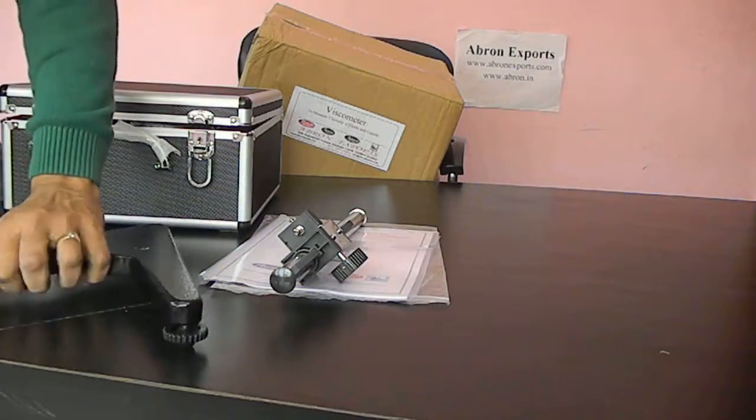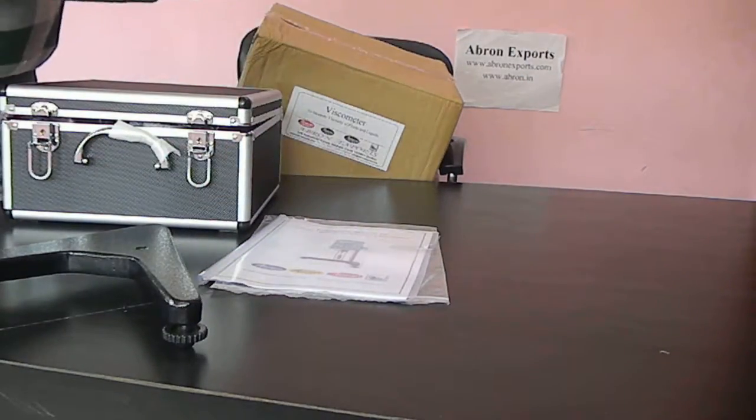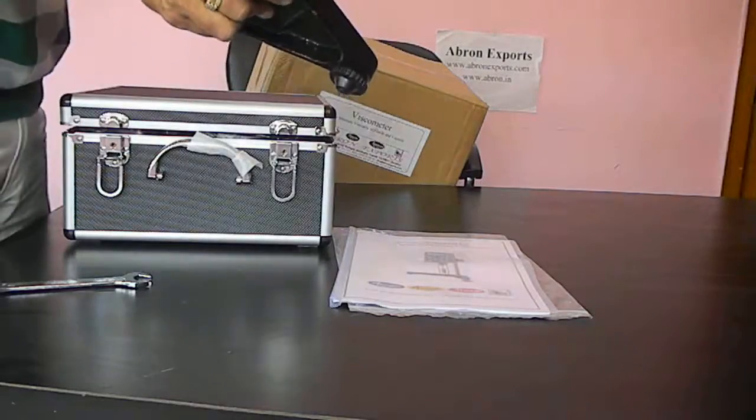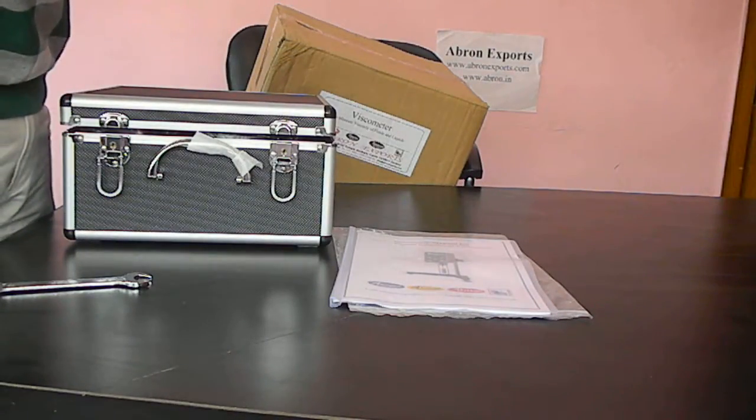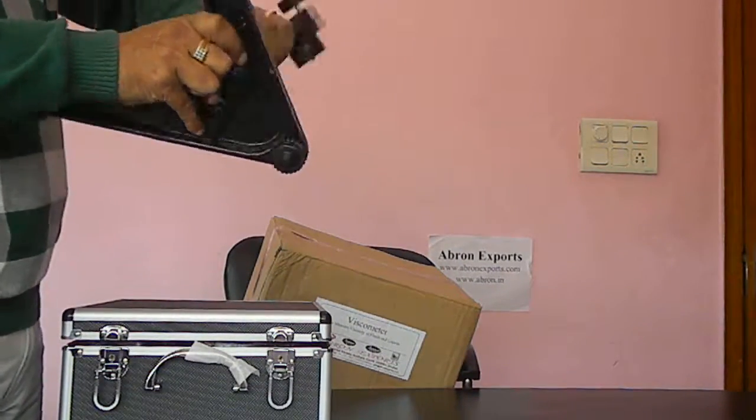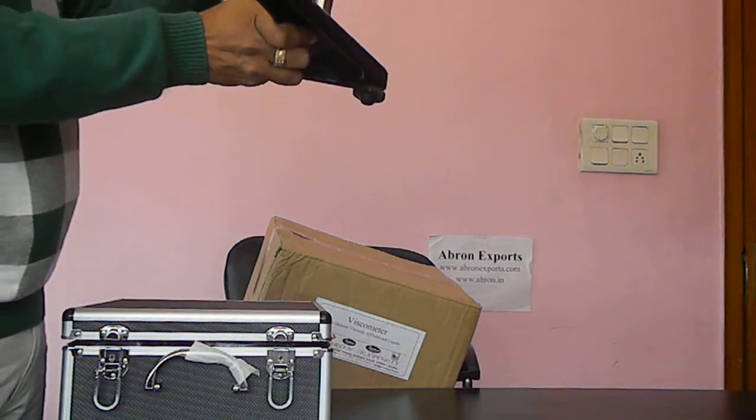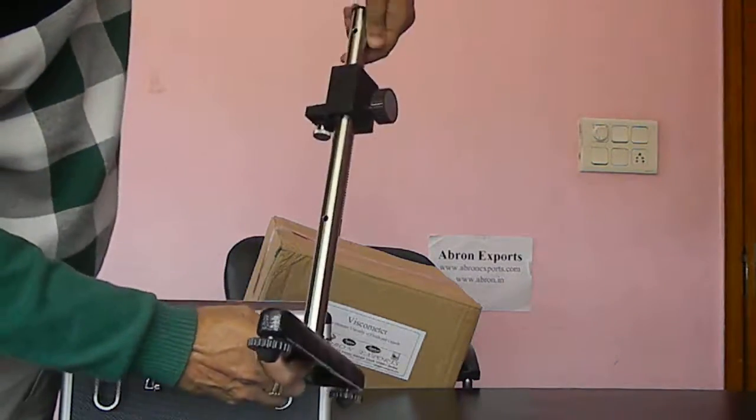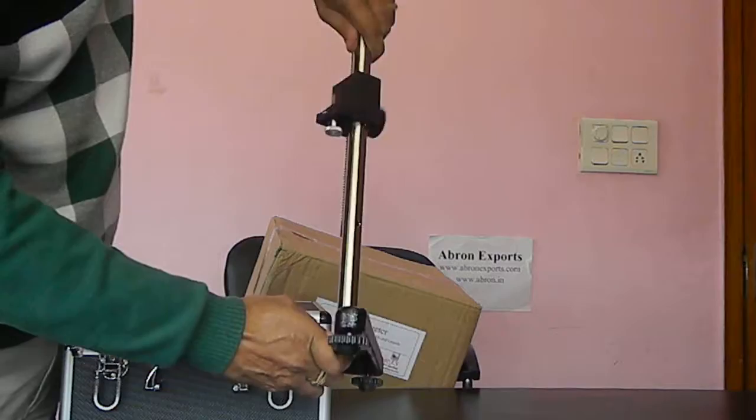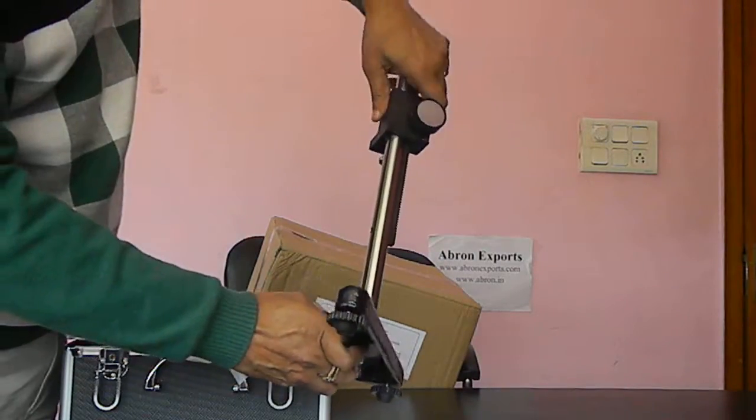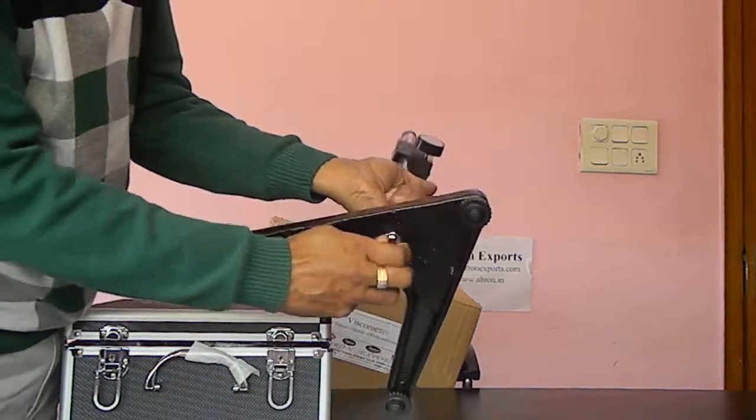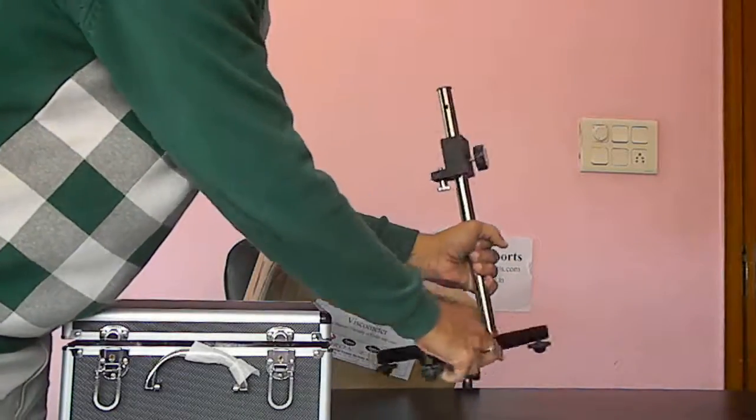This base will fix the base to the stand. There is a lock for additional security. Secure this. Leveling screws are there. Fix this first of all.